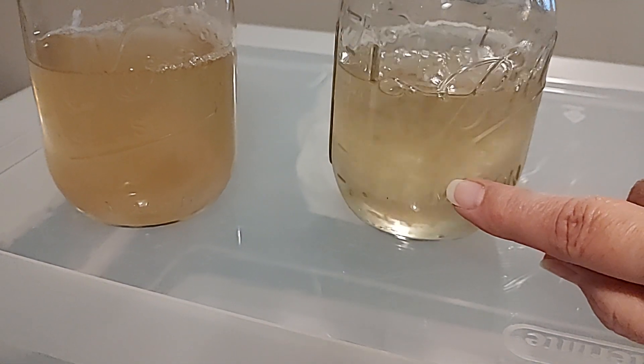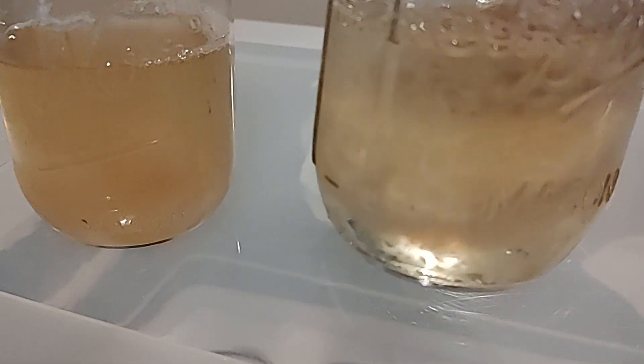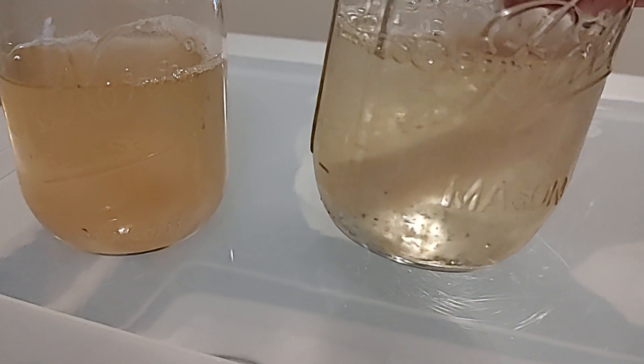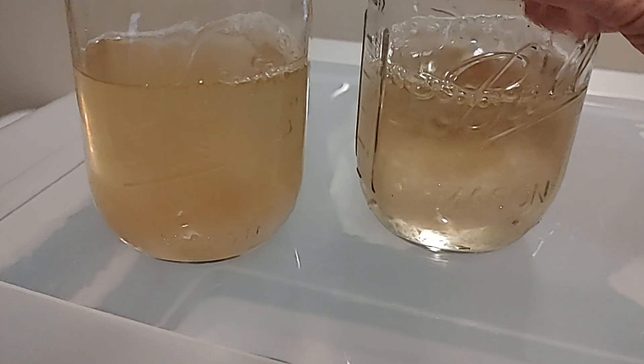This agar should be broken up. It looks really amazing - you can see all the mycelium. So here's what we're going to do.